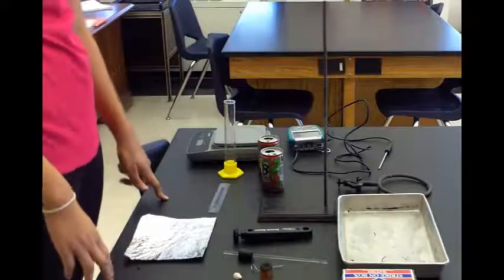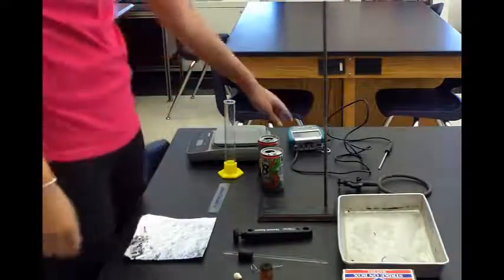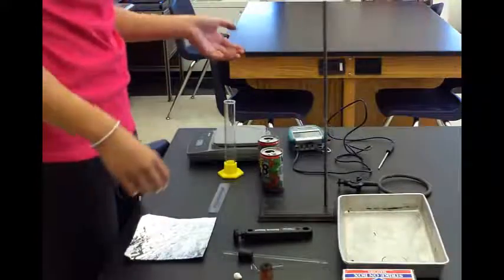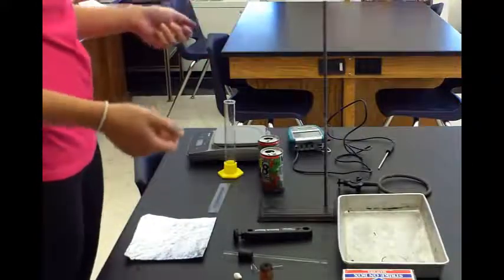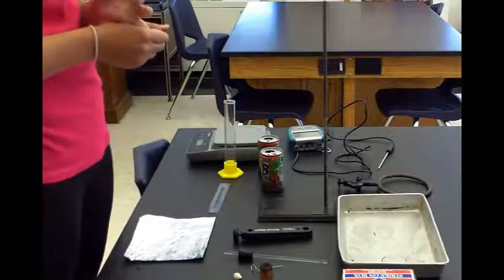Okay, so we're going to do the energy and food lab. Get all your supplies out of the basket onto your table. Turn on your lab quest first so you know it's on, and plug it in and charge it. The first thing you need to do is get your goggles—those need to be on at all times.